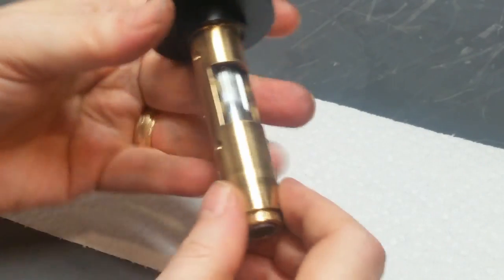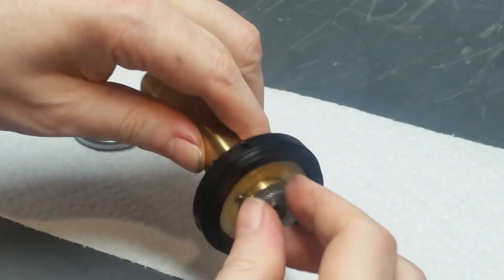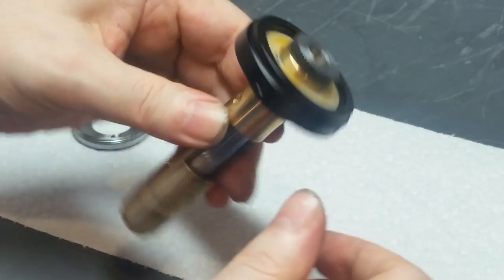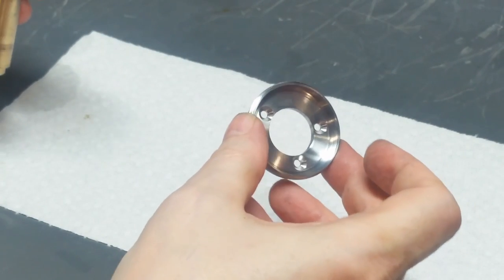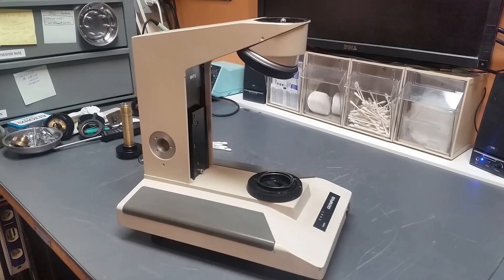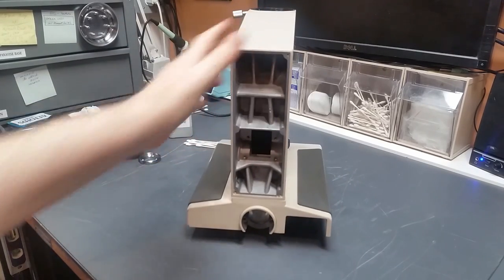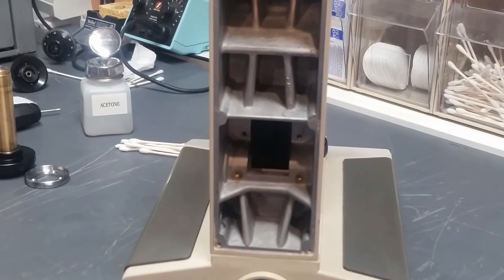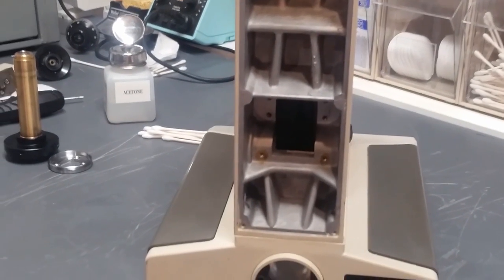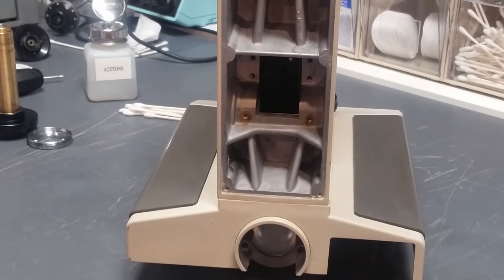Okay, this thing is pre-assembled, runs really smooth, and is ready to go back into the scope. This is ready to go back as well. Okay, here's the scope, and we're going to put the pinion assembly in to start with. Okay, I think we're ready to go.